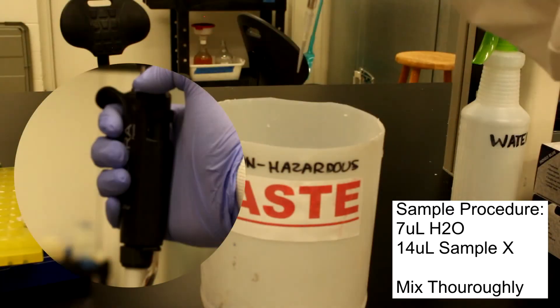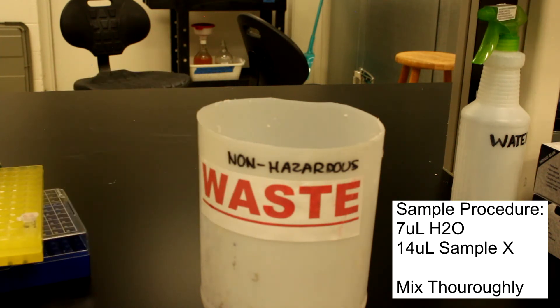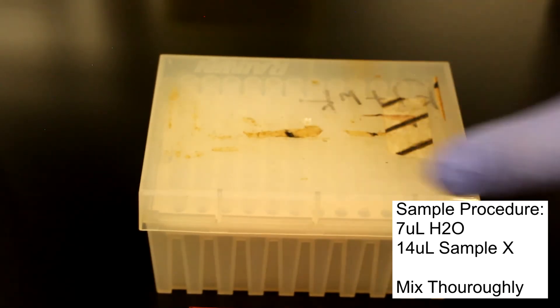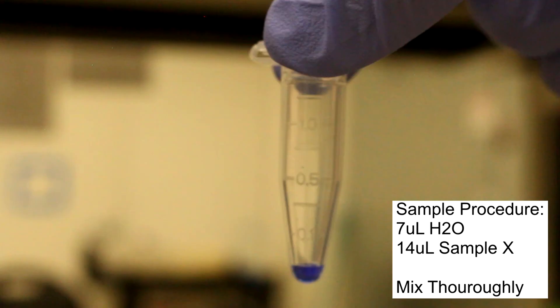The tip is once again ejected. The tip box is then closed to prevent contamination. Our solution of 7 microliters water and 14 microliters sample X is then prepared.